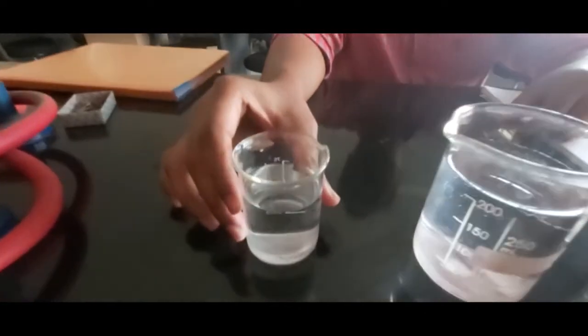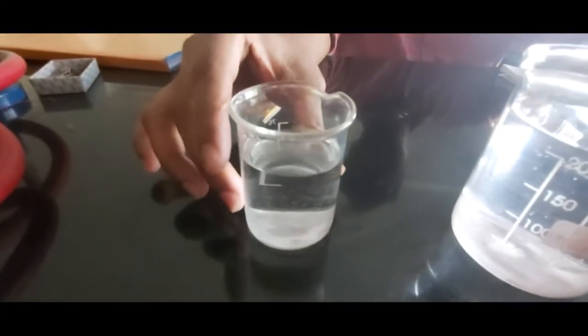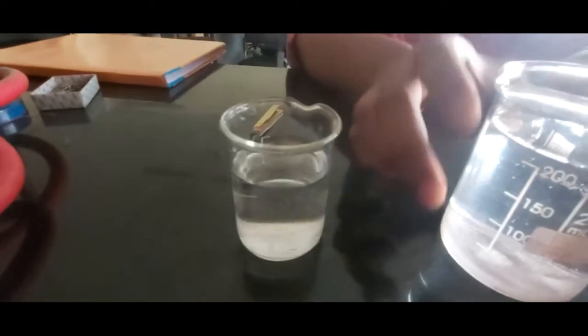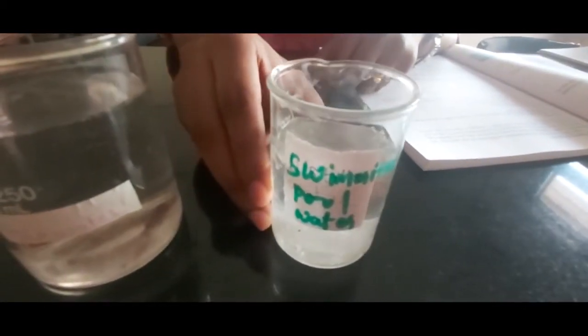For this experiment we are going to use three solutions. The first is the distilled water — we will be testing it for pH. The second one is the tap water, and the third water sample is the swimming pool water.